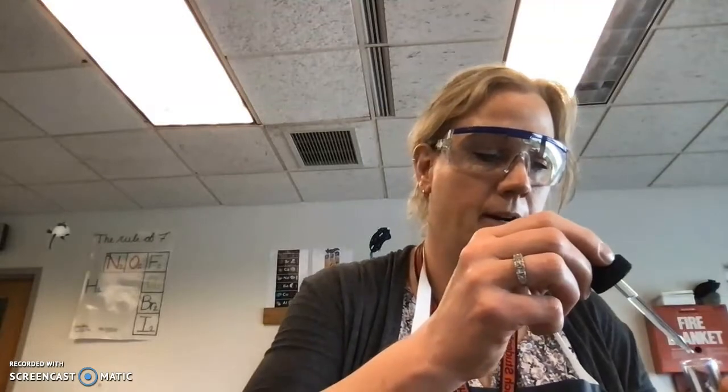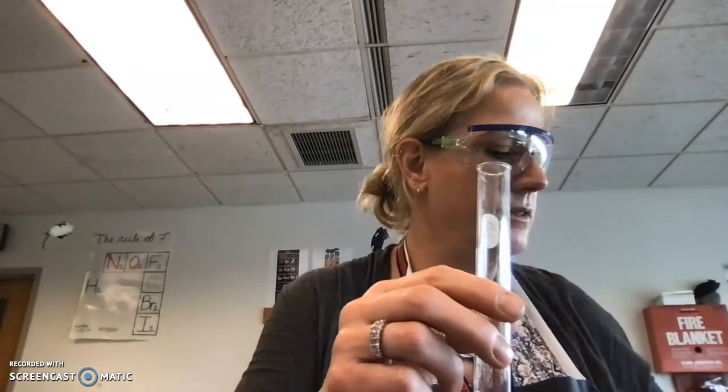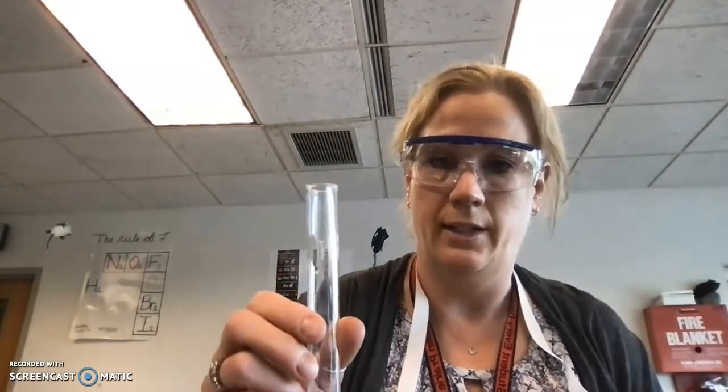One more set is to look at a different acid. So we're going to look at sulfuric acid, which is diprotic, 2 protons instead of 1 like hydrochloric. Similar, I'm going to do the same, add my drop of phenolphthalein. I only have 2 mils of this, so this is going to really be comparing how many drops it takes to neutralize this one compared to the same 2 milliliters of the 0.1 molar. That one didn't stay pink, but this one did. So we will see if it takes more or less base to neutralize the same volume of sulfuric acid.